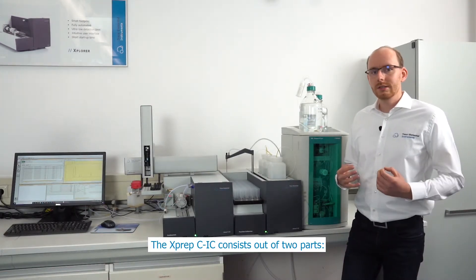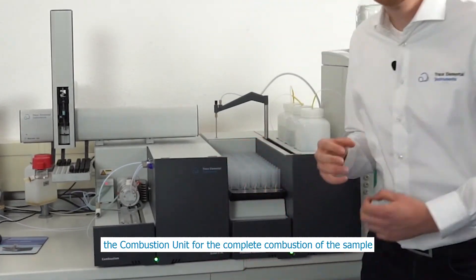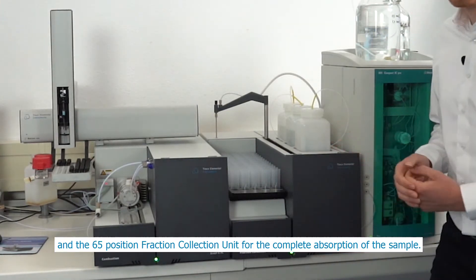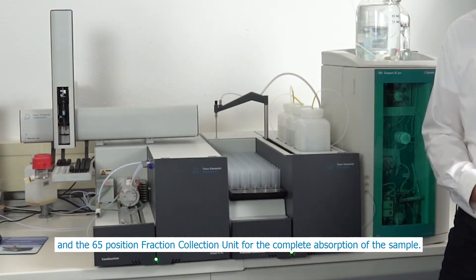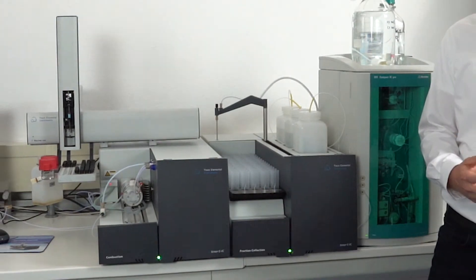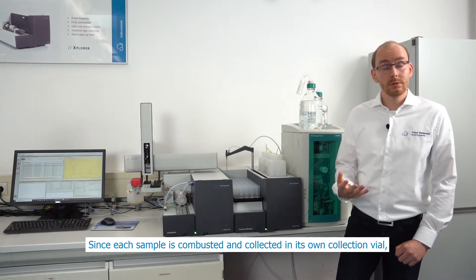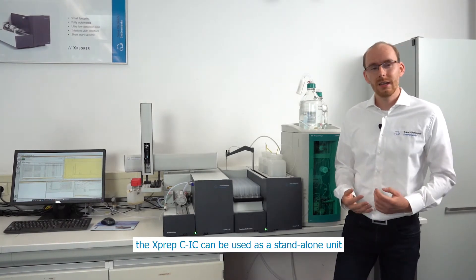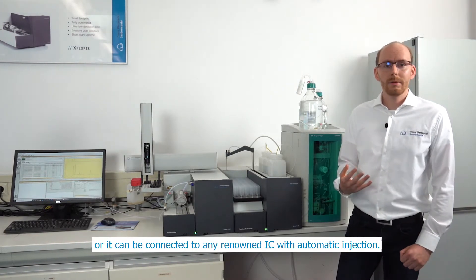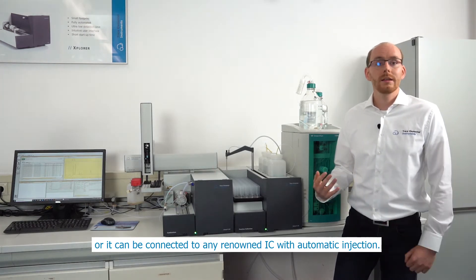The X-PREP CIC consists of two parts: the combustion unit for the complete combustion of the sample, and the 65-position fraction collection unit for the complete absorption of the sample. Since each sample is combusted and collected in its own collection vial, the X-PREP CIC can be used as a standalone unit or connected to any renowned IC with automatic injection.